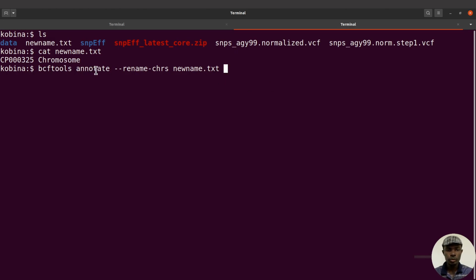So we have bcftools annotate --rename-chrs, and then we supply it with a text file which has the information, and then we specify the inputs as well as the outputs. All right. Now I will start with the output first. I'll say -o, and I'll say snips_AGY99.normalize.renamed.vcf. So this is going to be the output file.